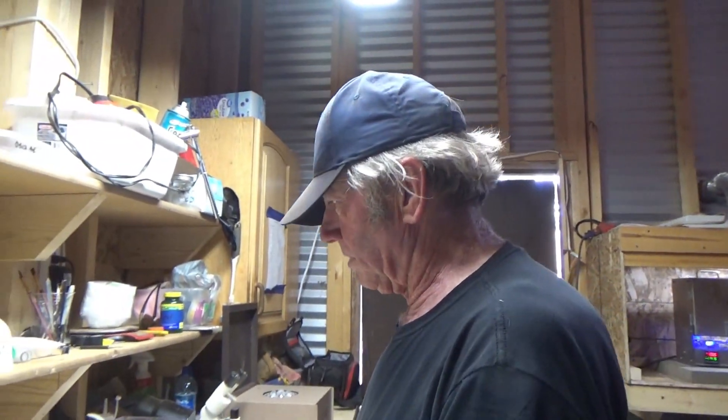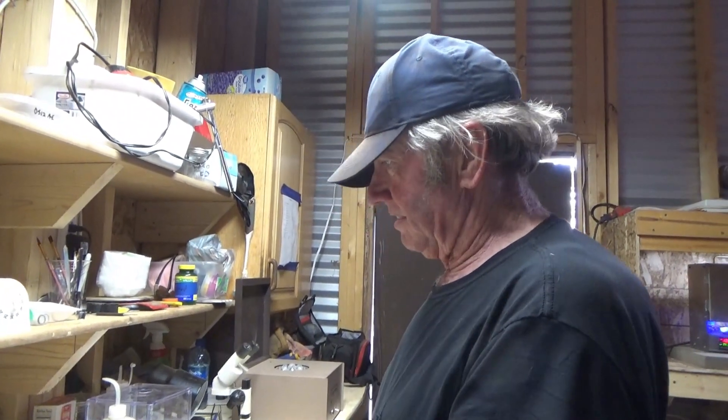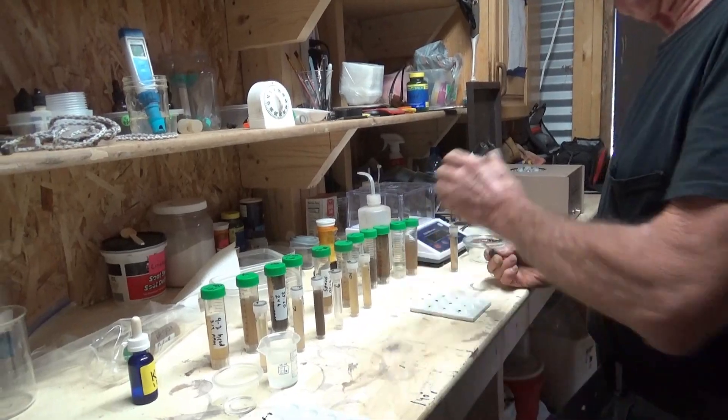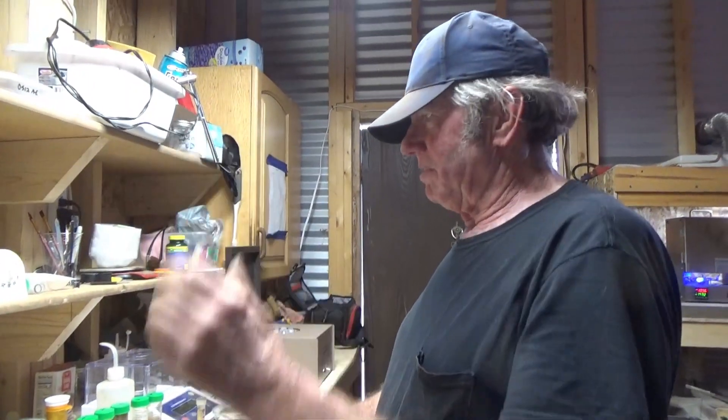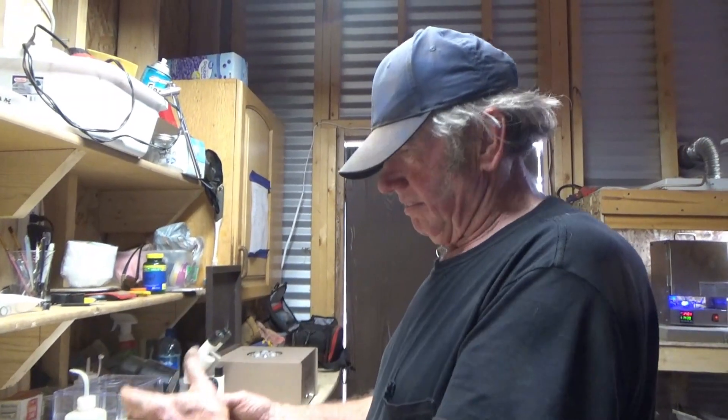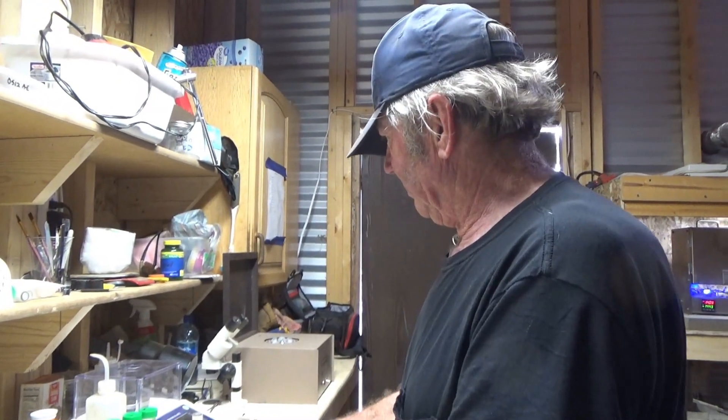All of these samples are different concentrations running from about 0.2 to 17 parts per million. As you can see they have different amounts of sediment in them, so we're basically getting kind of a random sample of the kind of solutions we're going to get.